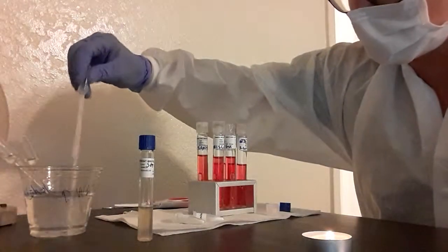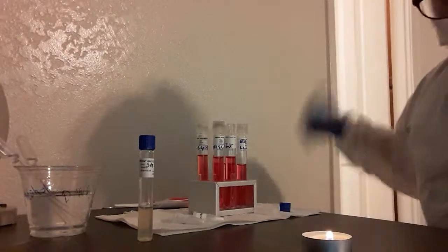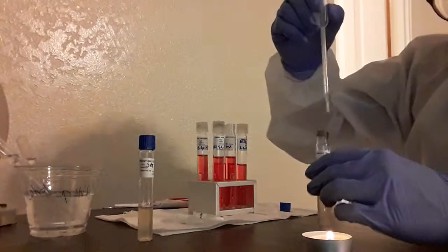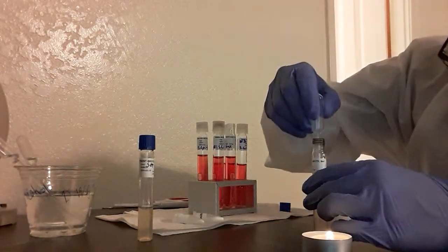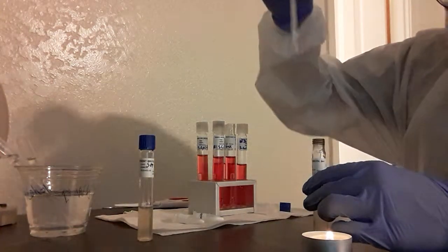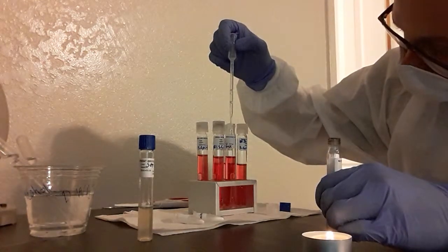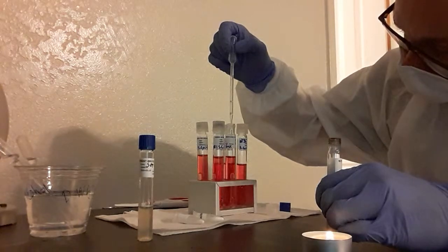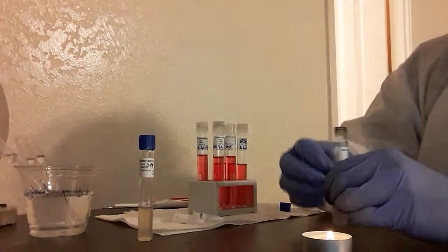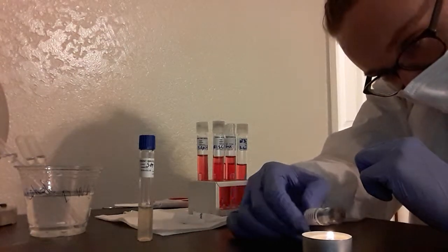I'm going to grab my pipette, kick out all the alcohol that's been sitting in, and shake it out till it's dry. And then I'm going to grab 4, probably a little more than that. I'm going to drop 4 into here. 4 drops: 1, 2, 3, 4. Put that back in the alcohol. I'm going to re-sterilize for later, which is going to be the whole entire rest of the tubes I have.